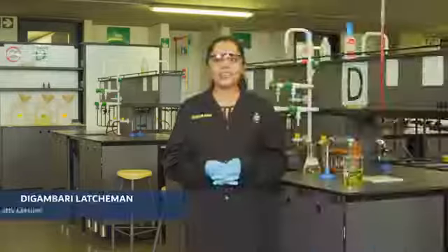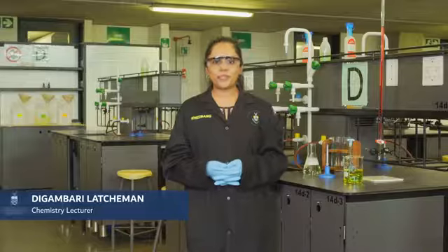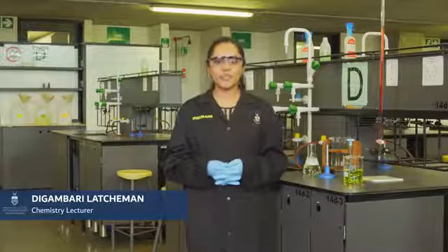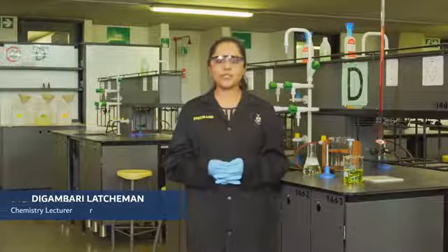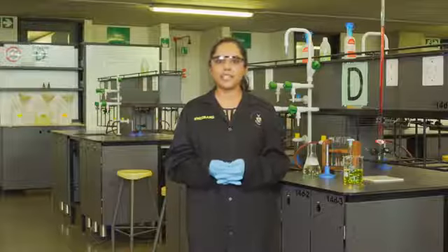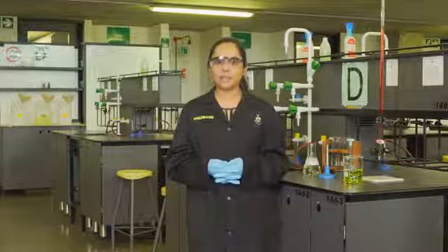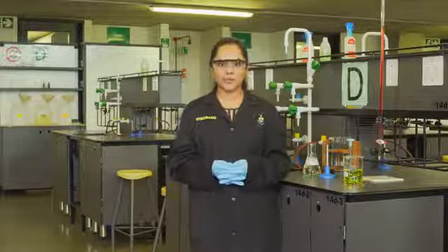Hi everyone. In this video we will be discussing waste disposal in the chemistry lab. Towards the end of your experiment you will have accumulated chemical waste which will need to be accurately disposed of.